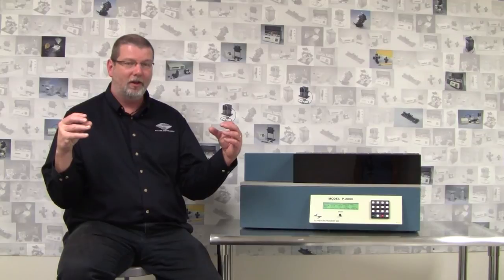We have taken a very close look at the events that take place as a quartz glass capillary is heated and then pulled into a patch pipette, and we have captured this exciting process on film.